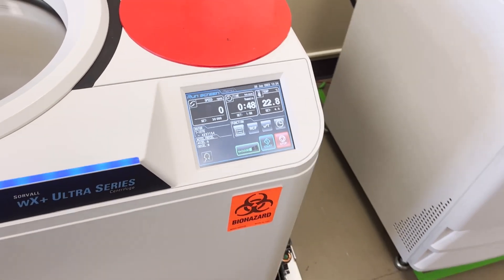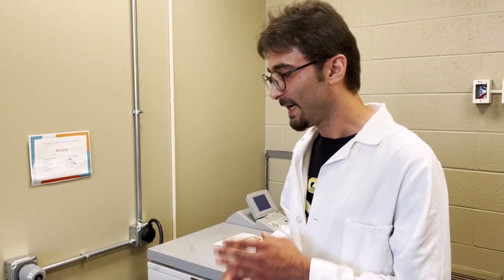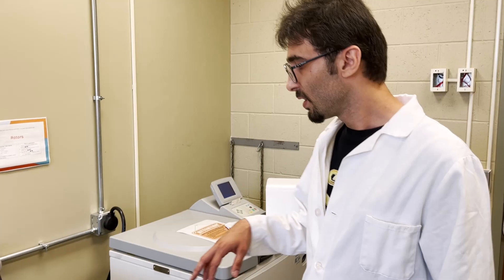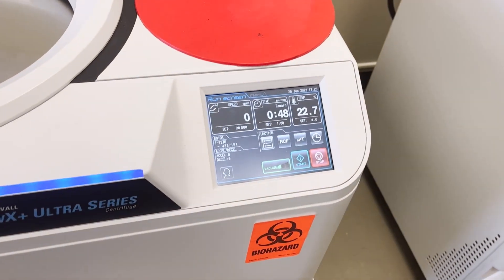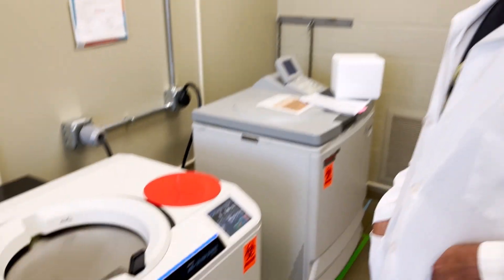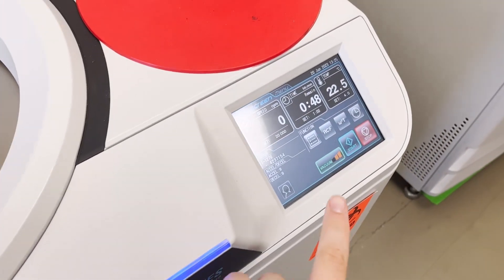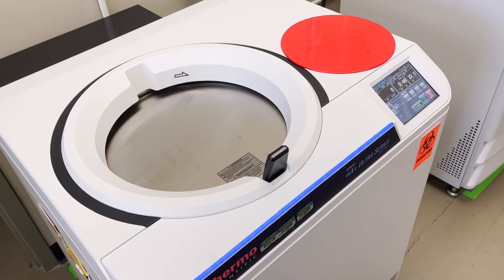The last important point is the accelerator and decelerator settings — this is the rate at which the centrifuge ramps up to the maximum RPM you set, and at the end, the rate at which it ramps down to zero. I always set both to 9 and 9, to go slowly up and slowly down, which I think is best for our conditions.